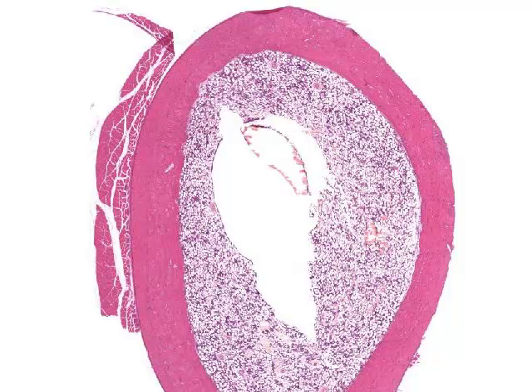Okay, this is a nice slide to look at, particularly to contrast with the previous slide which you'd seen, in which we looked at a section of ground bone. This is a piece of bone that's been cut in cross-section, and this piece of bone has been decalcified. So chemically, the calcium has been removed, leaving behind only really the collagenous core or structure of the osteoid and the cells, and that enables it to be sectioned thinly, and we're going to look at this and examine it in just a moment.